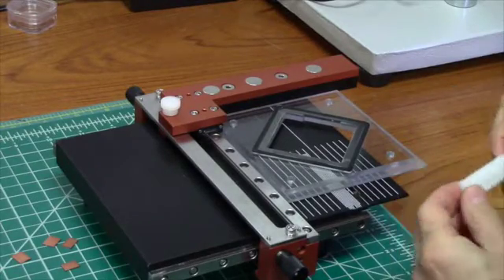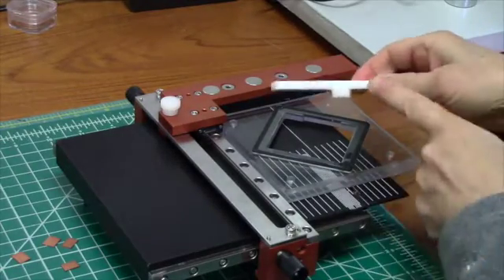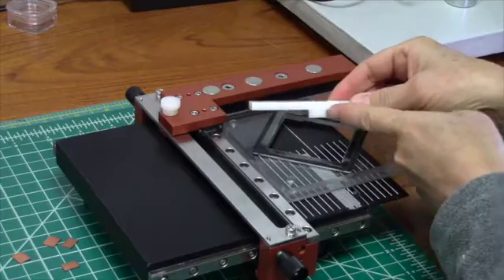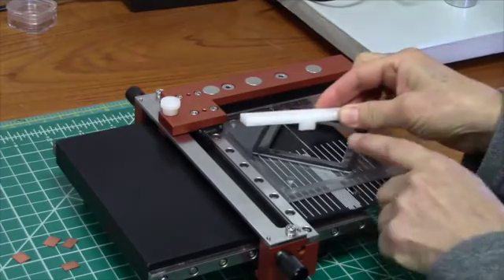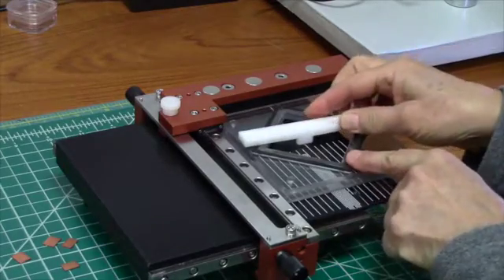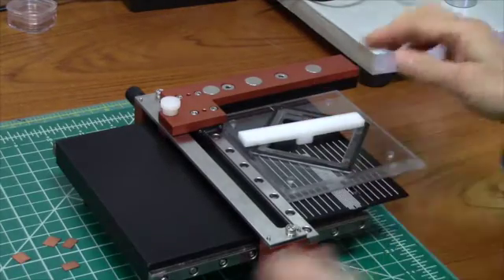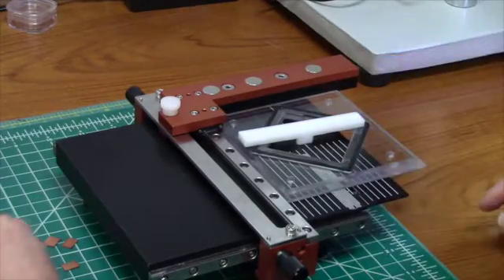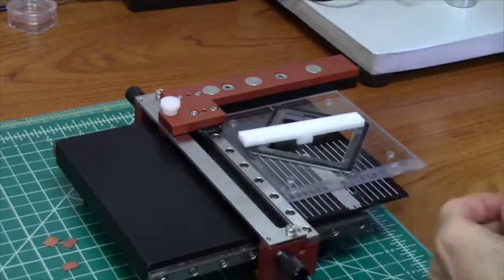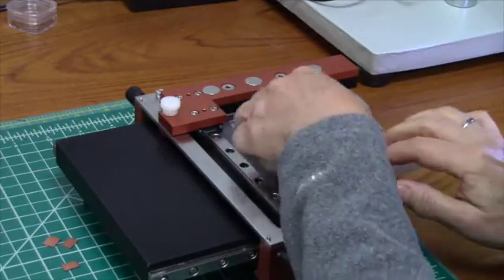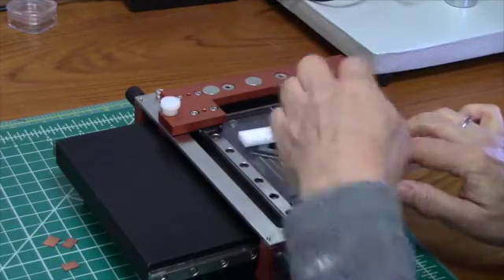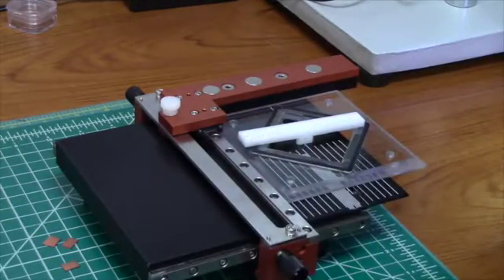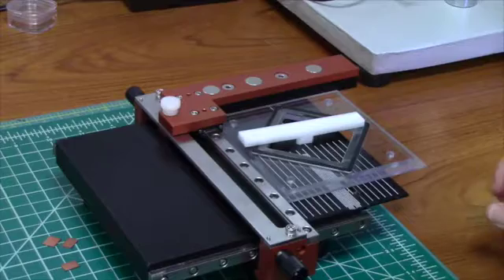Then take the hold down with the flat facing you. Take your sample and put it in the corner of the holder.